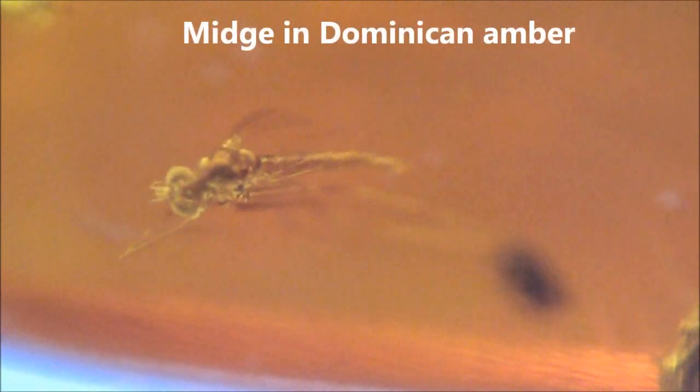With this device, we can take a look right into the crystal eyes of a trilobite, or an insect trapped in a piece of amber.